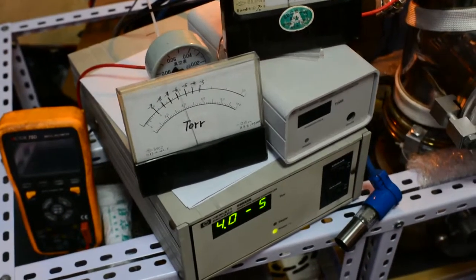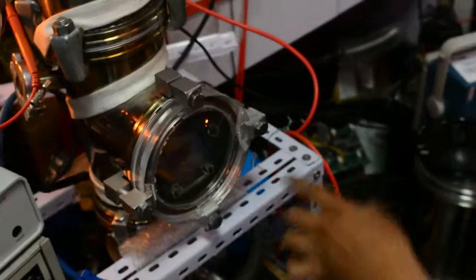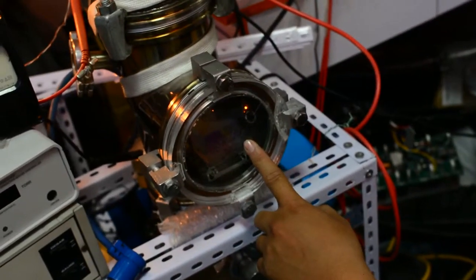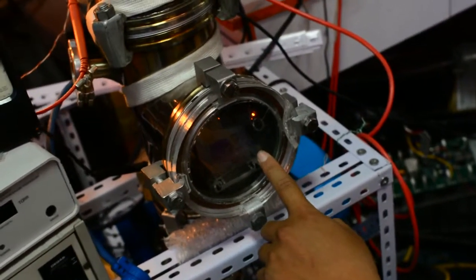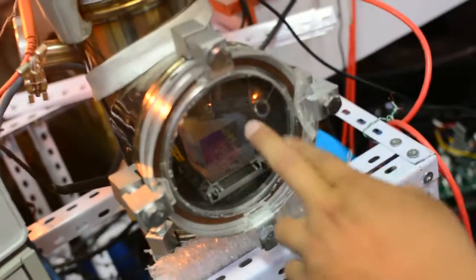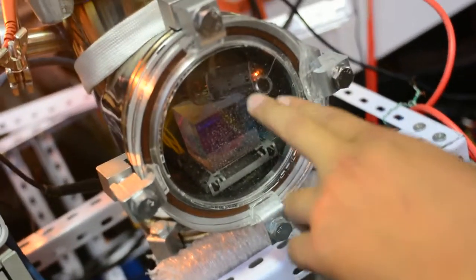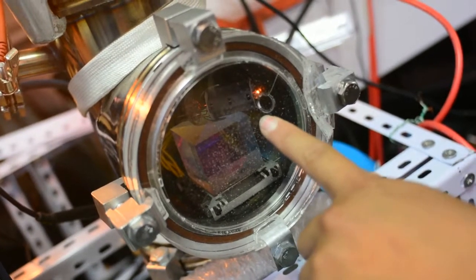This is the whole system. The vacuum tube is still alive. Basically, it shows me this vacuum chamber is working well. I am not killing anything.